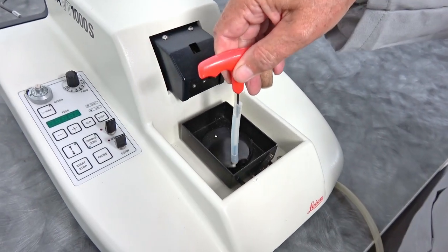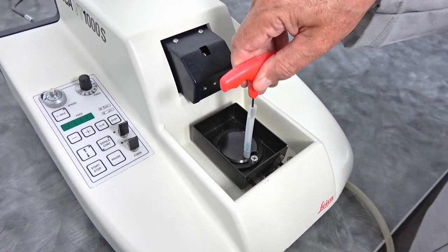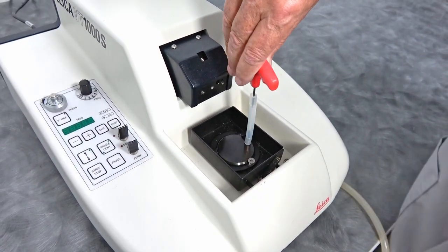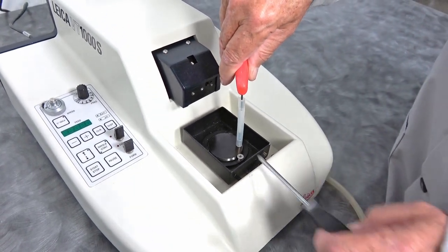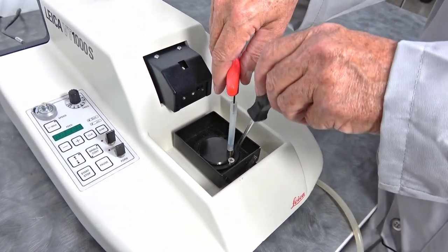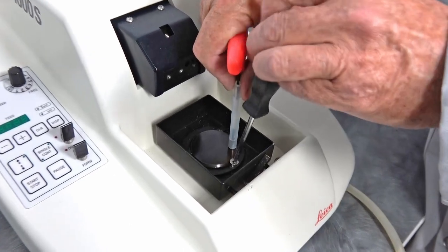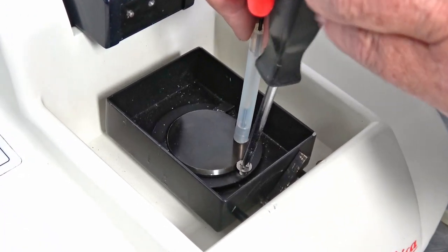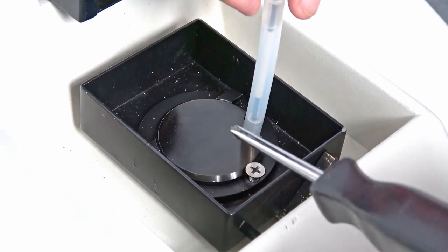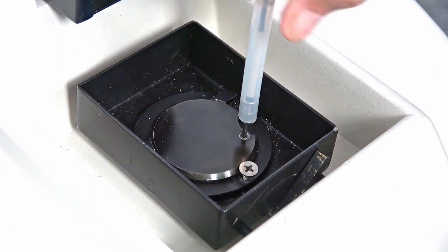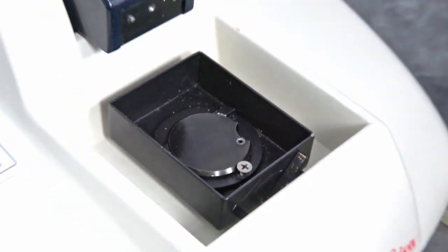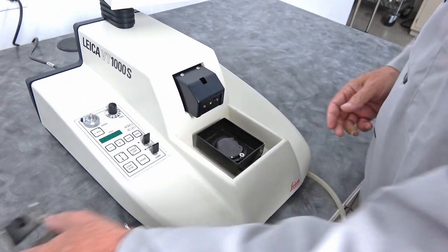You drop the unit into place, you drop the stage into place, the sample, turn it to wherever you want it. Fasten, tighten the screw down. The stage is now locked into place. You can raise your magnet and now it releases. Install your blade.